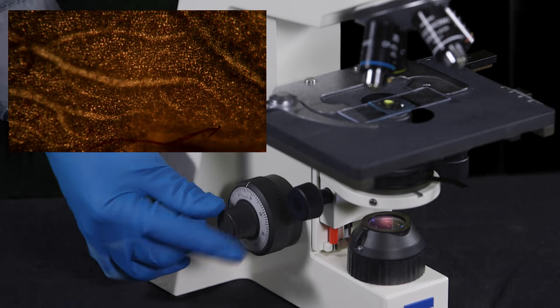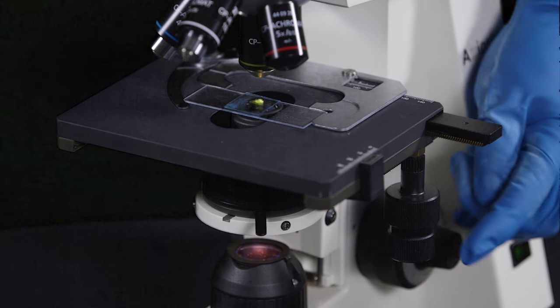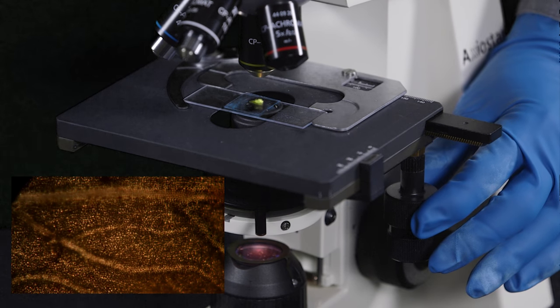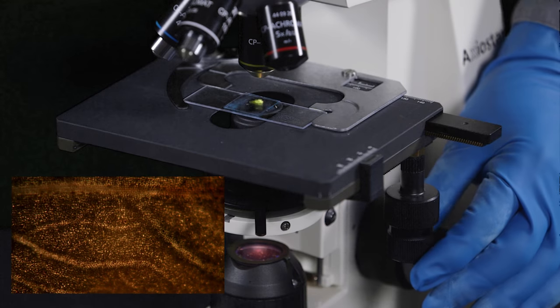Refocus the specimen with the fine focus knob and re-center it in your field of view with the stage adjustment knobs.